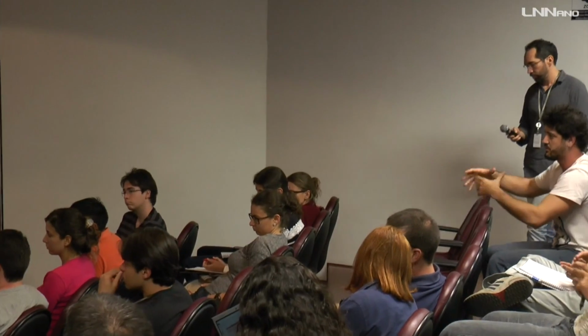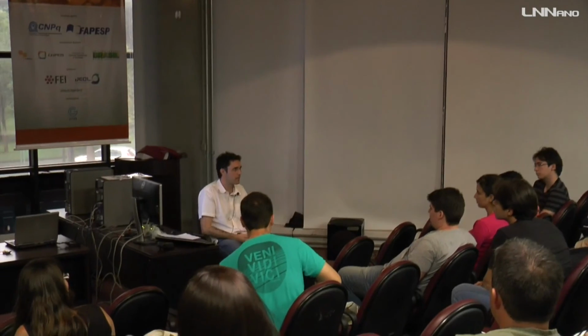The difference between the setup of ADF and this change that I did.